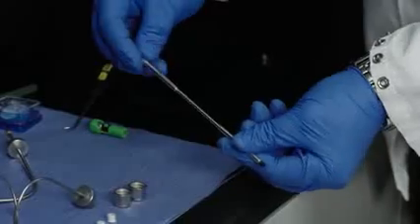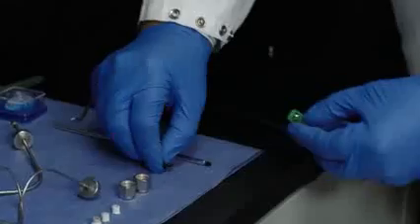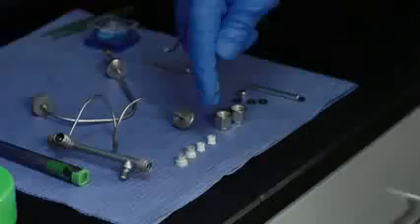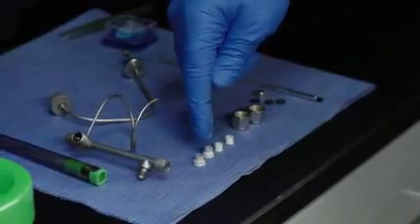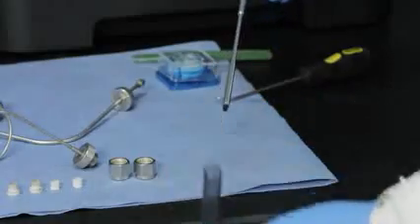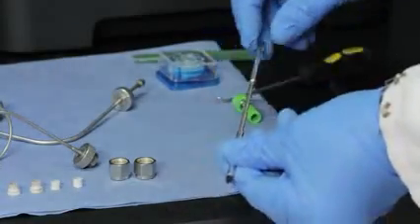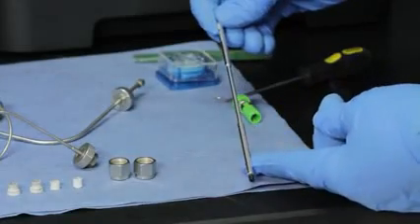Heater tube, test section, o-rings, ferrules, test filter. For this example we'll use an intelligent heater tube, but the JFTOT 4 is also compatible with the original Alcor heater tubes just like the previous generation JFTOT.